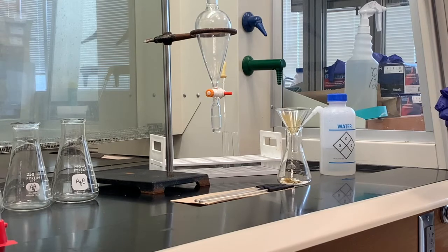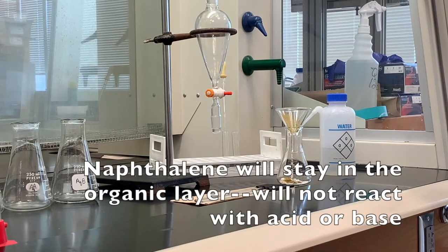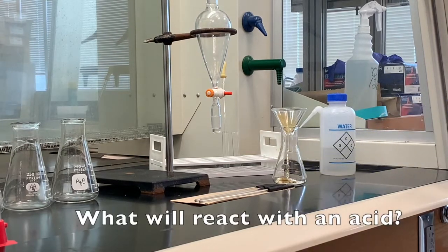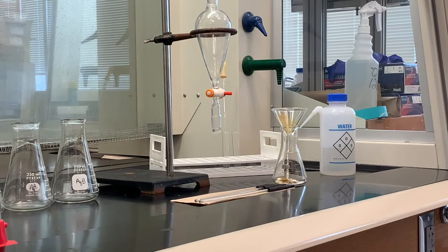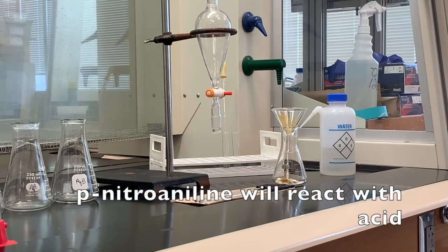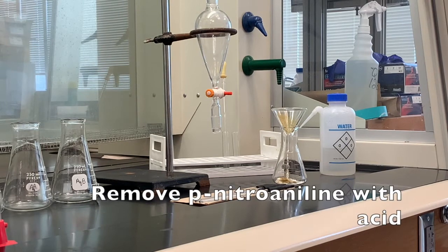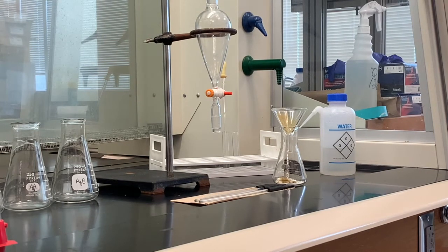Well, the naphthalene, which is a neutral compound, will not react with acid or base, so it will always stay within the organic layer. If we were to add acid to the organic mixture, then we have to think about what reacts with acids. The substance in this mixture that would react with an acid would be the p-nitroaniline. Aniline has an amino group within its structure, and amino groups are very similar to ammonia, NH3, which has basic properties, if you will. So if we add acid to the mixture, we can remove the p-nitroaniline because it would rather go with the acid than stay in the organic layer.